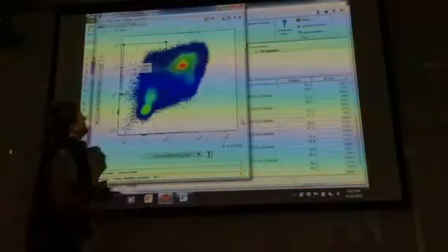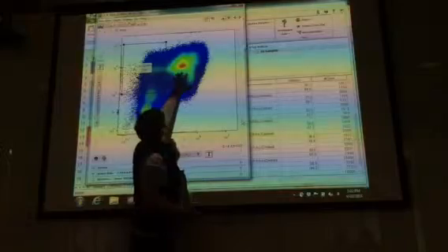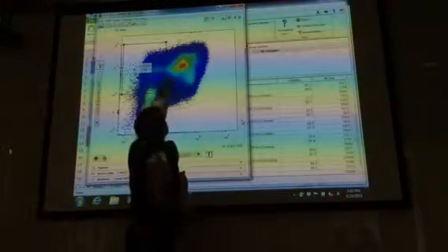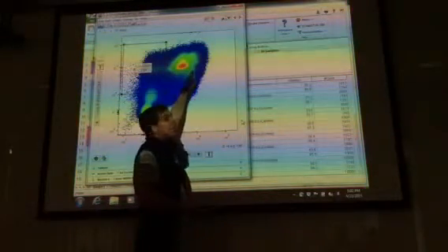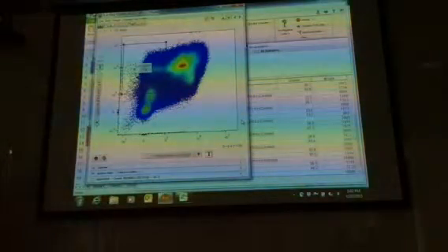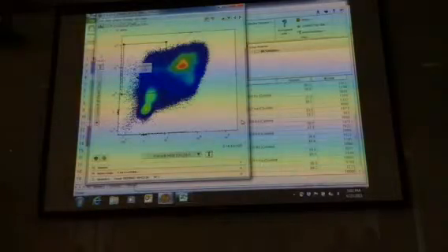Okay, well they lack markers of lineage commitment. So you might think, okay, well everything that you see here, this large population of cells, this is actually the lineage positive cells. So then where does this line go? And this is what I was talking about in terms of being consistent with what you do.